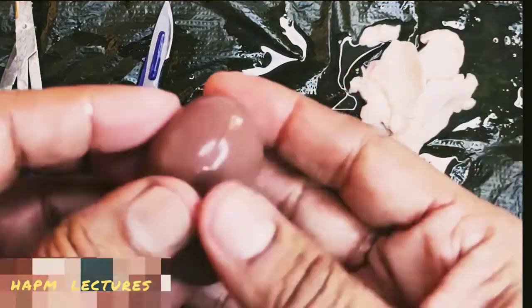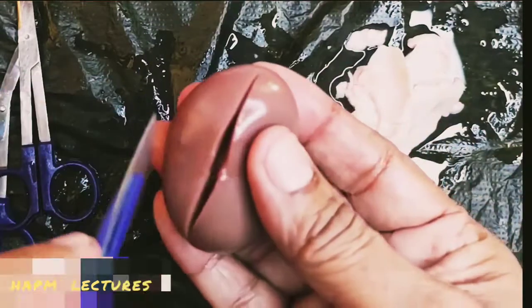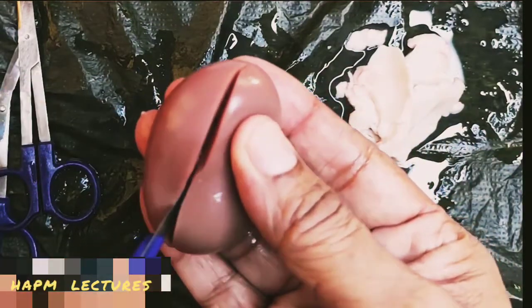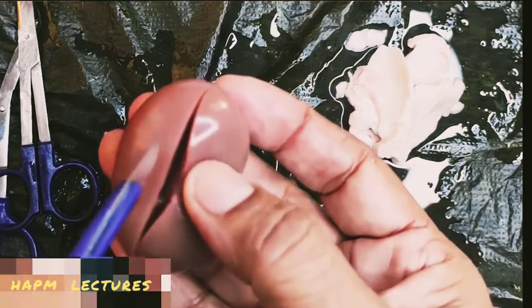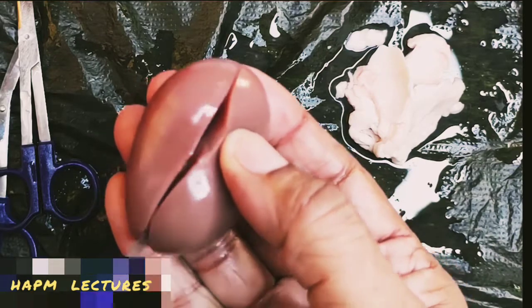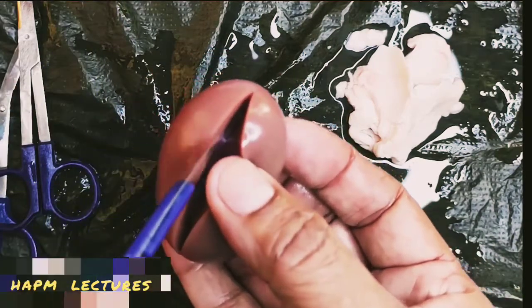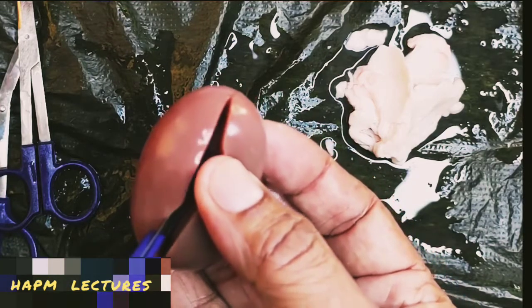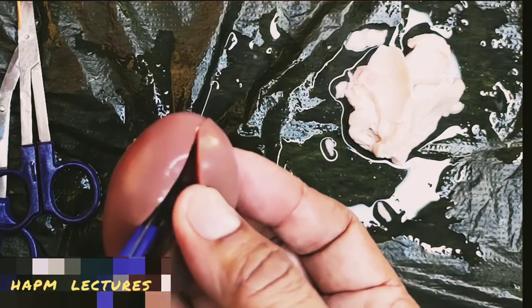Now we will cut this. As we go on cutting, the outer one is the cortex. Inner to that we observe the medulla. The renal cortex is the outer, peripheral reddish brown structure, which is granular and contains the Malpighian bodies.